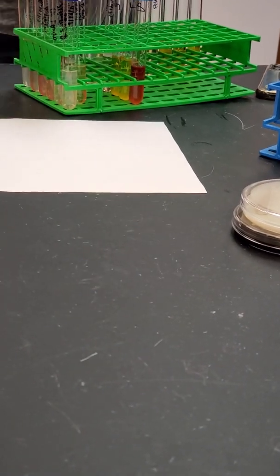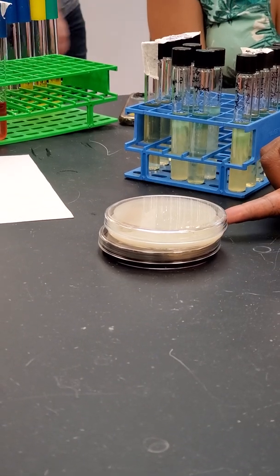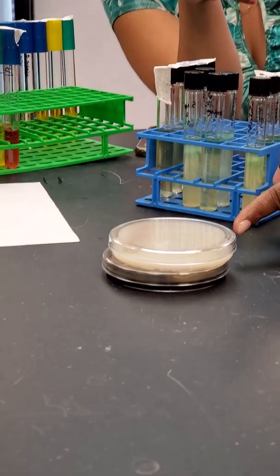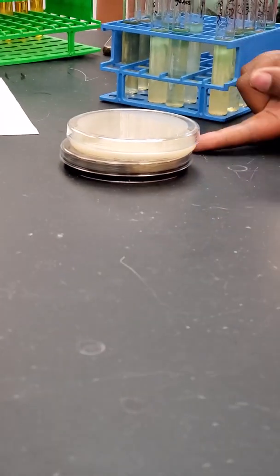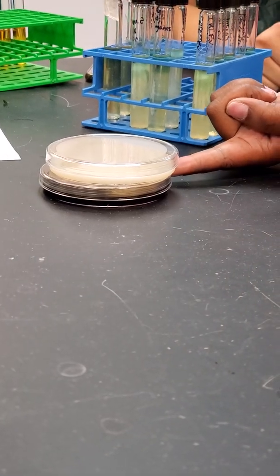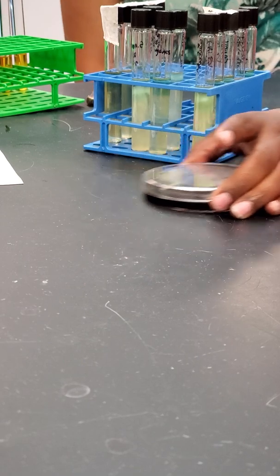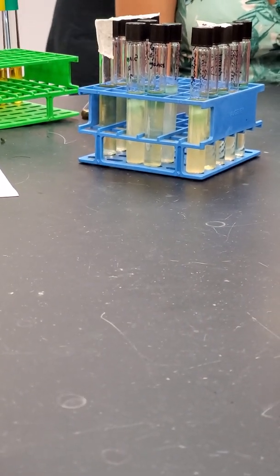Hey Myra, what happened to the starch hydrolysis? Hydrolysis is the first one, right? This one, the milk. This is starch hydrolysis, yeah. That was a skim milk. The one on top, right? I'm looking for the bottom. What's the bottom one? The starch. The bottom should be the starch hydrolysis. This is the SMA, the skim milk agar. That's what I'm saying.